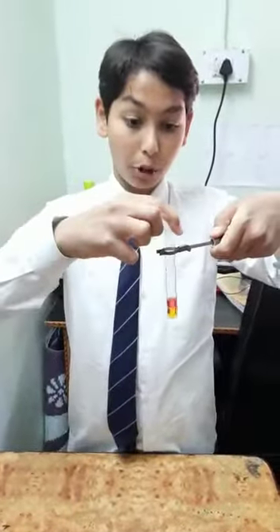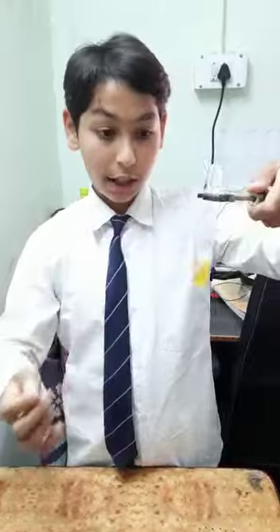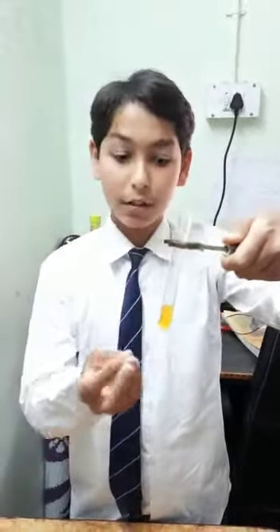And if we pour some sodium bicarbonate in it again, it again becomes yellow in color. So it is a base which is neutralized by an acid. Okay, thank you.